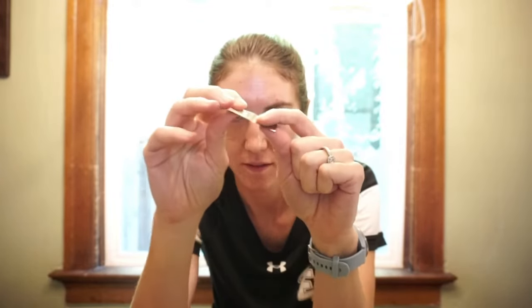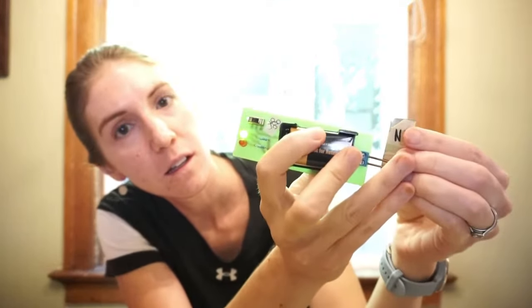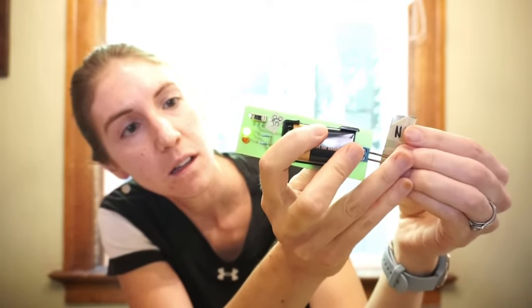Next up we have Ni, that's capital N, lowercase i. So take a look, see if you think it is shiny or dull. Let's see if I can bend it. I wonder if this conducts electricity. And, oh, is it magnetic?